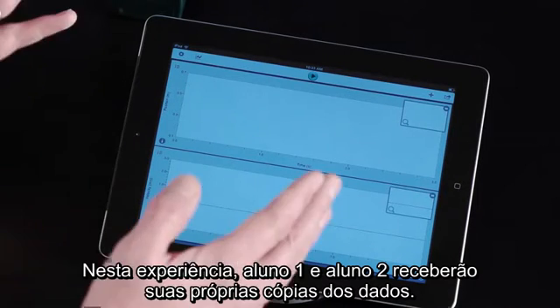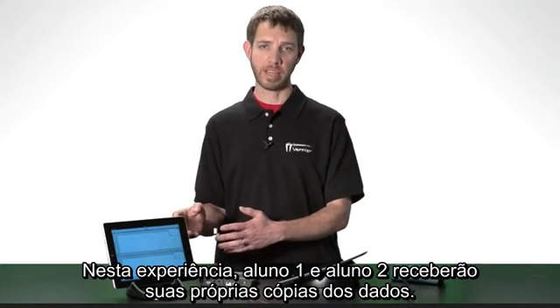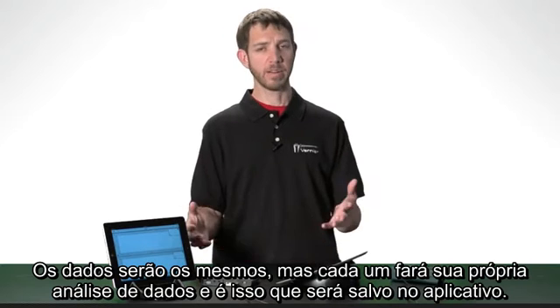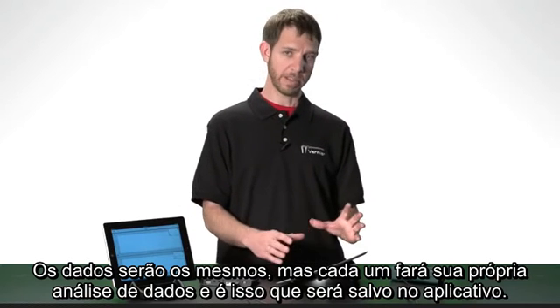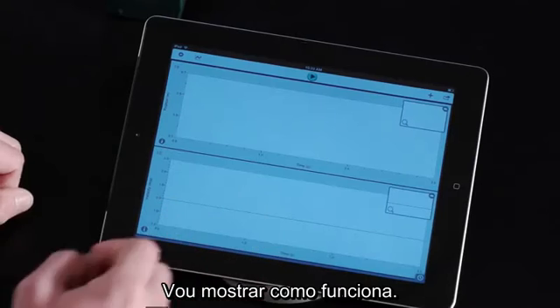In this experiment, student 1 and student 2 will both get their own copy of the data. The data will be the same, but each of them will do their own data analysis, and that is what will be saved in the app. Let me show you how it works.